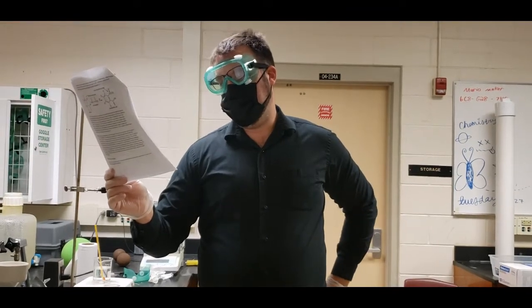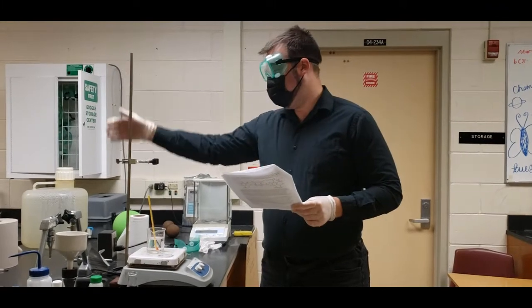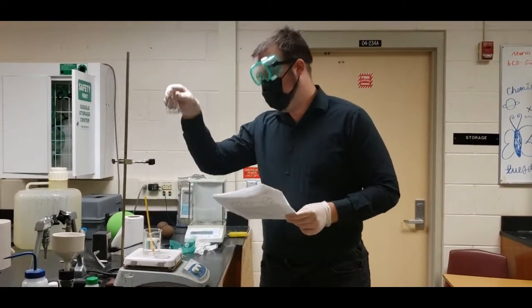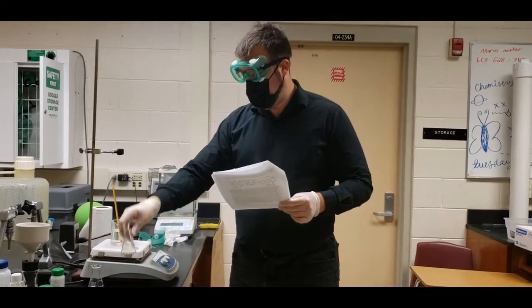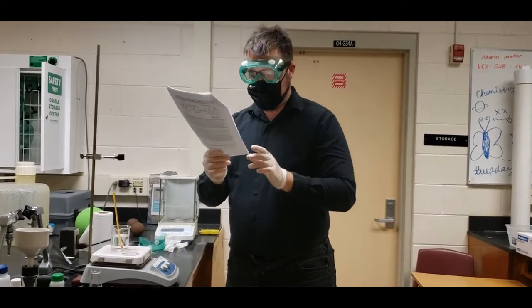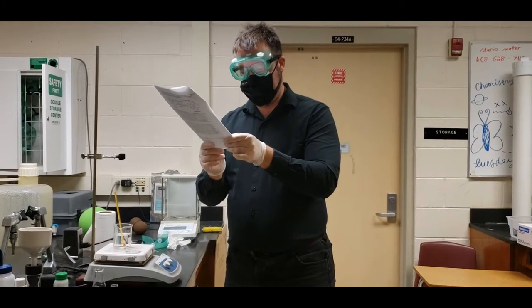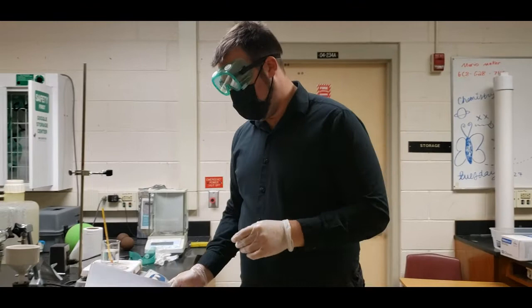Once there, we're going to go ahead and use this, our ring stand with a support. This is so that we can go ahead and gently place in our Erlenmeyer flask so that we can heat up our mixture. And then finally we have a test tube rack, thermometers, and stirring rods to help us finish out with the testing.